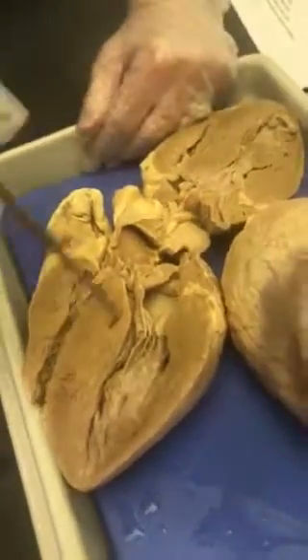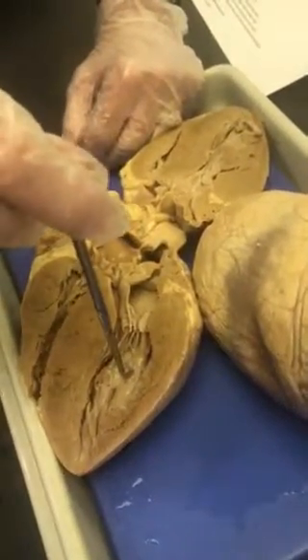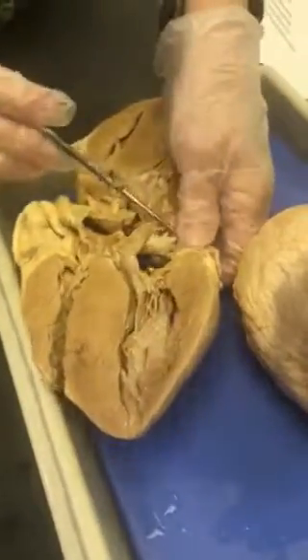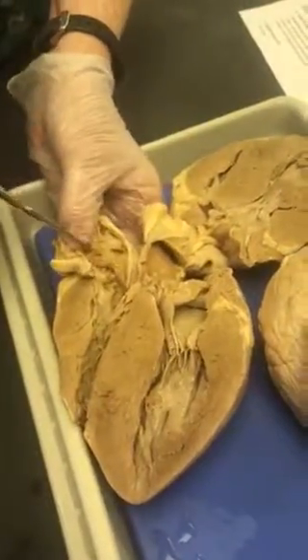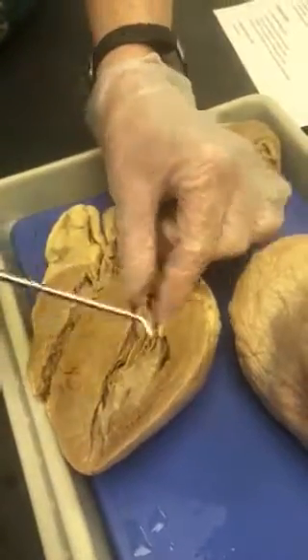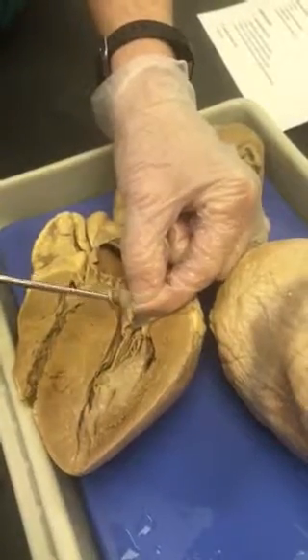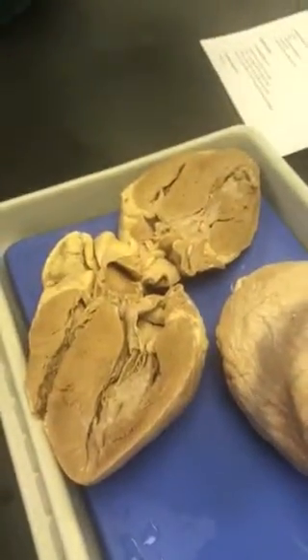All right, if I want you to name the left ventricle, then I'm just going to put a pin here and say name the chamber. Right ventricle, left atrium, right atrium. The valves, okay, remember on your left side, lab, the lab part, left atrium, you'll have your bicuspid or mitral or left AV.